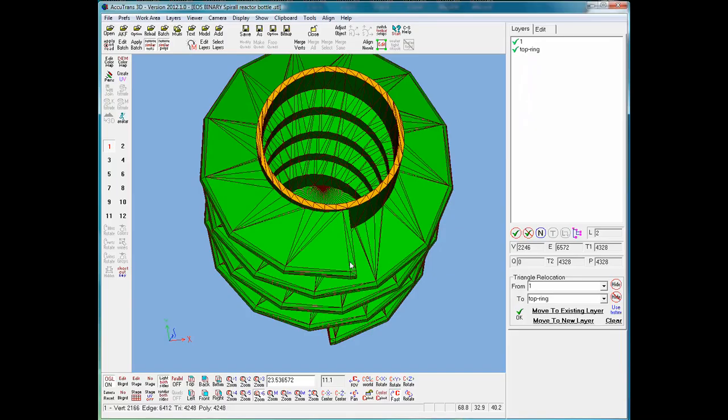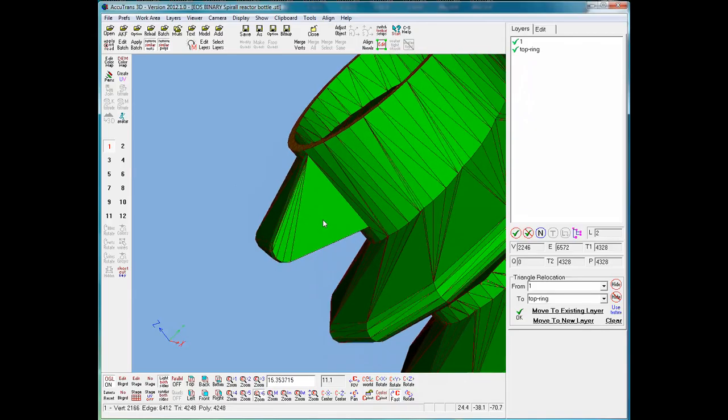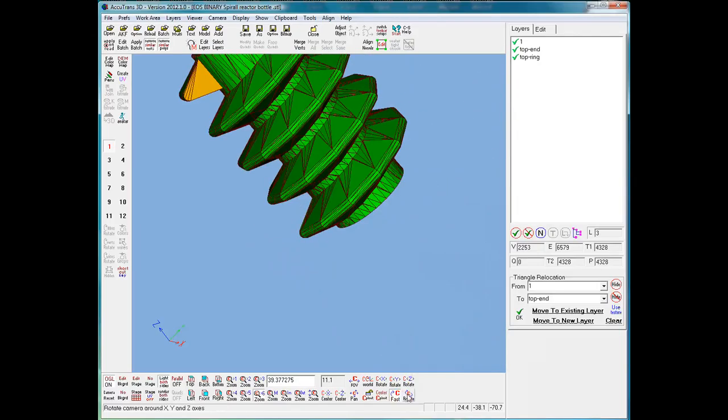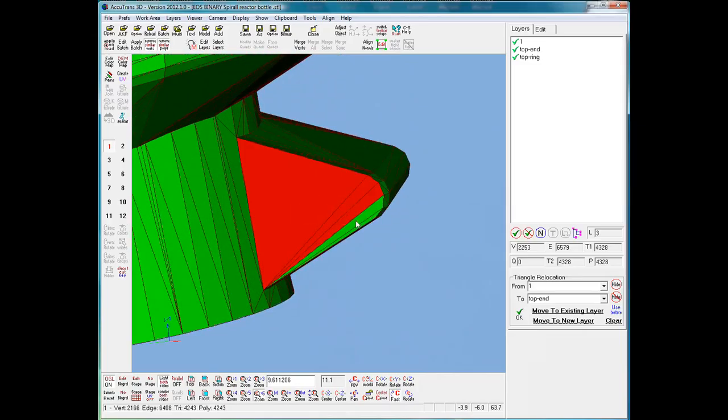one again. So now I'll middle mouse button click there, move around, do it again, zoom in, and now we'll select the triangles here, and we'll move those to a new layer, which we will call top end. Okay. Now we'll zoom out. Click down here. Get around. Click again. Zoom in. Select the triangles. Okay, and we'll move to a new layer, and we'll call this one bottom end.